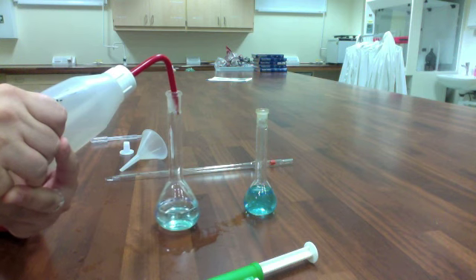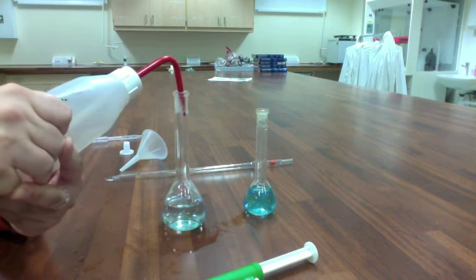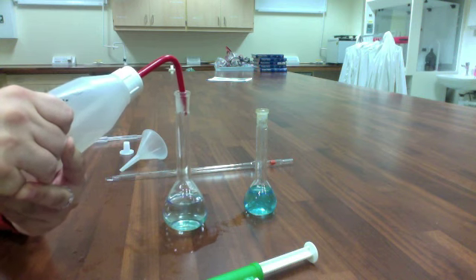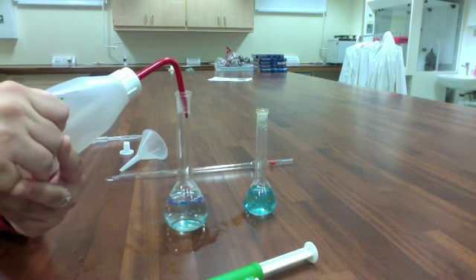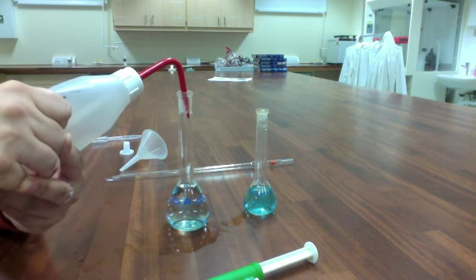And again, I'm doing the example from the pre-lab, which says a new 100mL solution. So that's why this volumetric flask is a little bit bigger. I could even dilute this in a 50mL solution. Some of you will do that in the lab.